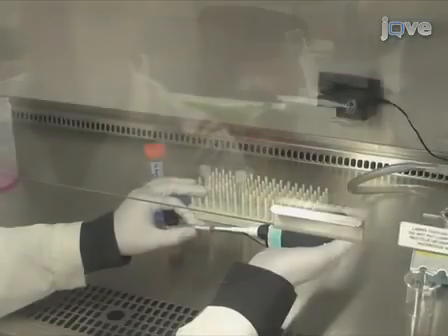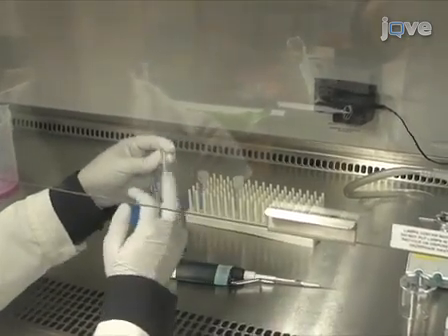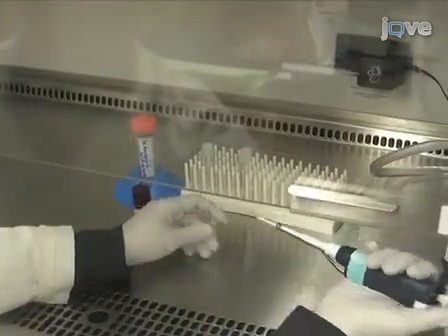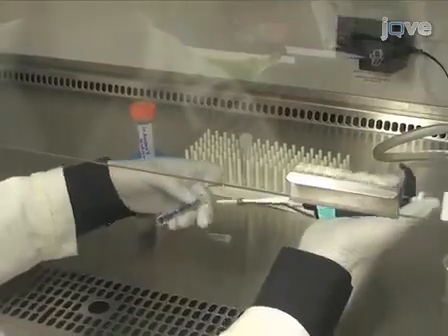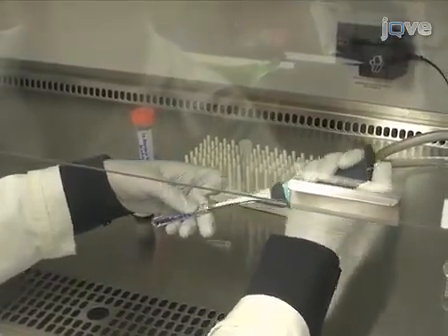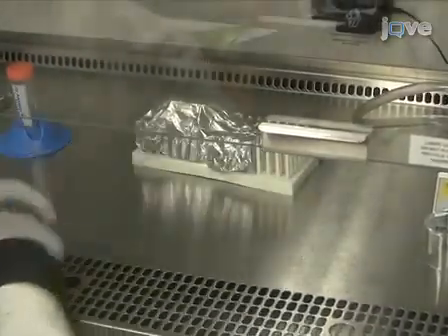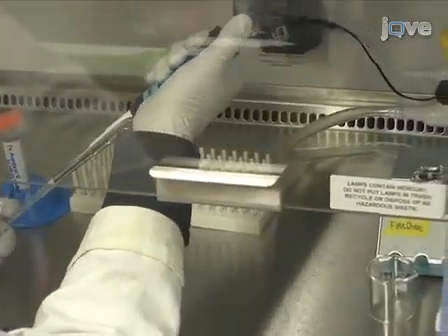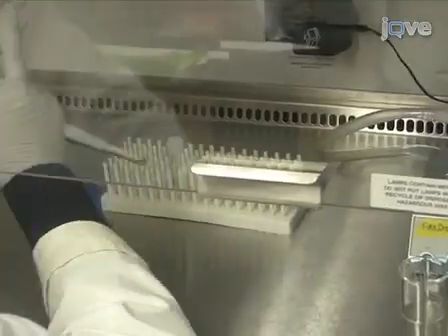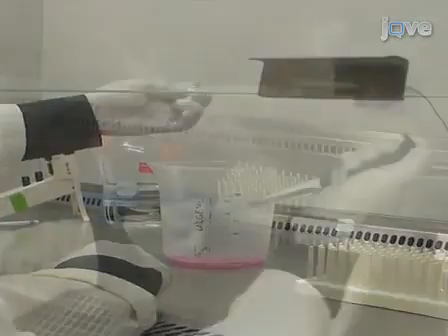Next, prepare a 1 to 10 dilution of Propidium Iodide, or PI, in 1x Annexin V binding buffer. Add 4 microliters of the diluted PI to each tube, yielding a final concentration of 2 micrograms per milliliter PI in each sample. Incubate the tubes in the dark again for 15 minutes at room temperature. After this incubation period, wash the cells with 500 microliters of 1x Annexin V binding buffer and centrifuge the samples at 335 g for 10 minutes at 4 degrees Celsius and decant the supernatant.